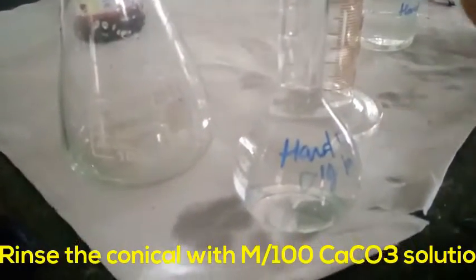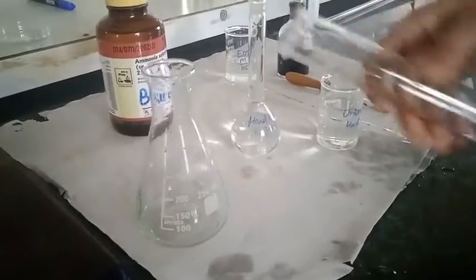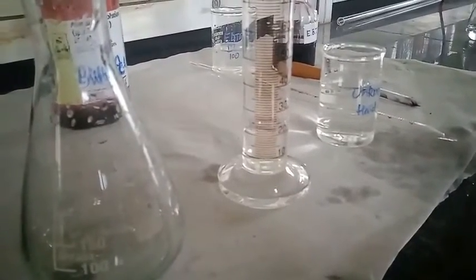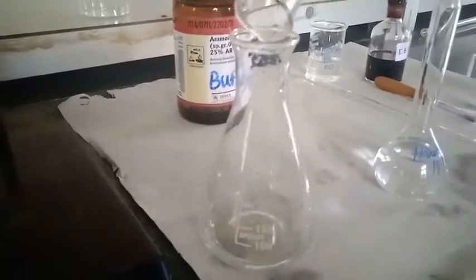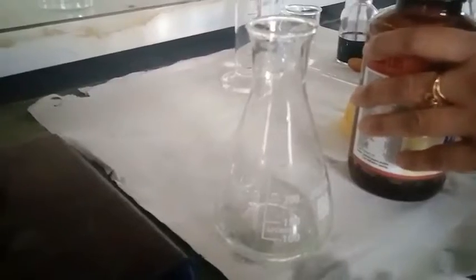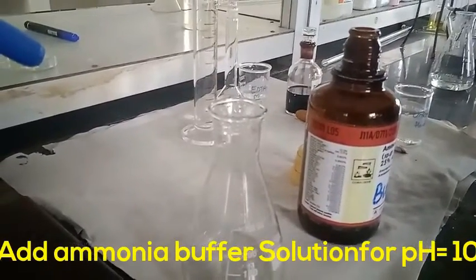Now I am going to take the standard hard water which I have prepared. Before using this hard water, I am going to rinse my measuring cylinder as well as the conical flask. Now I am going to take 25 mL of this standard hard water and transfer it into the rinsed conical flask. After transferring the hard water, I am going to add 0.5 mL of basic buffer to maintain the pH at about 10.